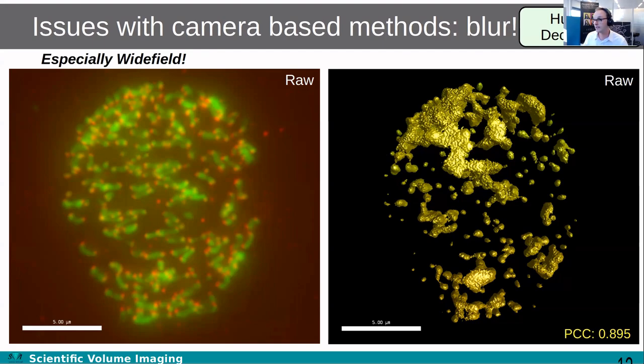In any case, what that does is it creates an overestimation of your colocalization. Here for this raw image, the Pearson coefficient is 0.89, so 90%. That's just because all of the blur everywhere is colocalizing, and that's really the majority of your signal. If you make a representation of that, you can see where my colocalization is happening. It's happening here, which isn't very good. It is not a specific type of colocalization.